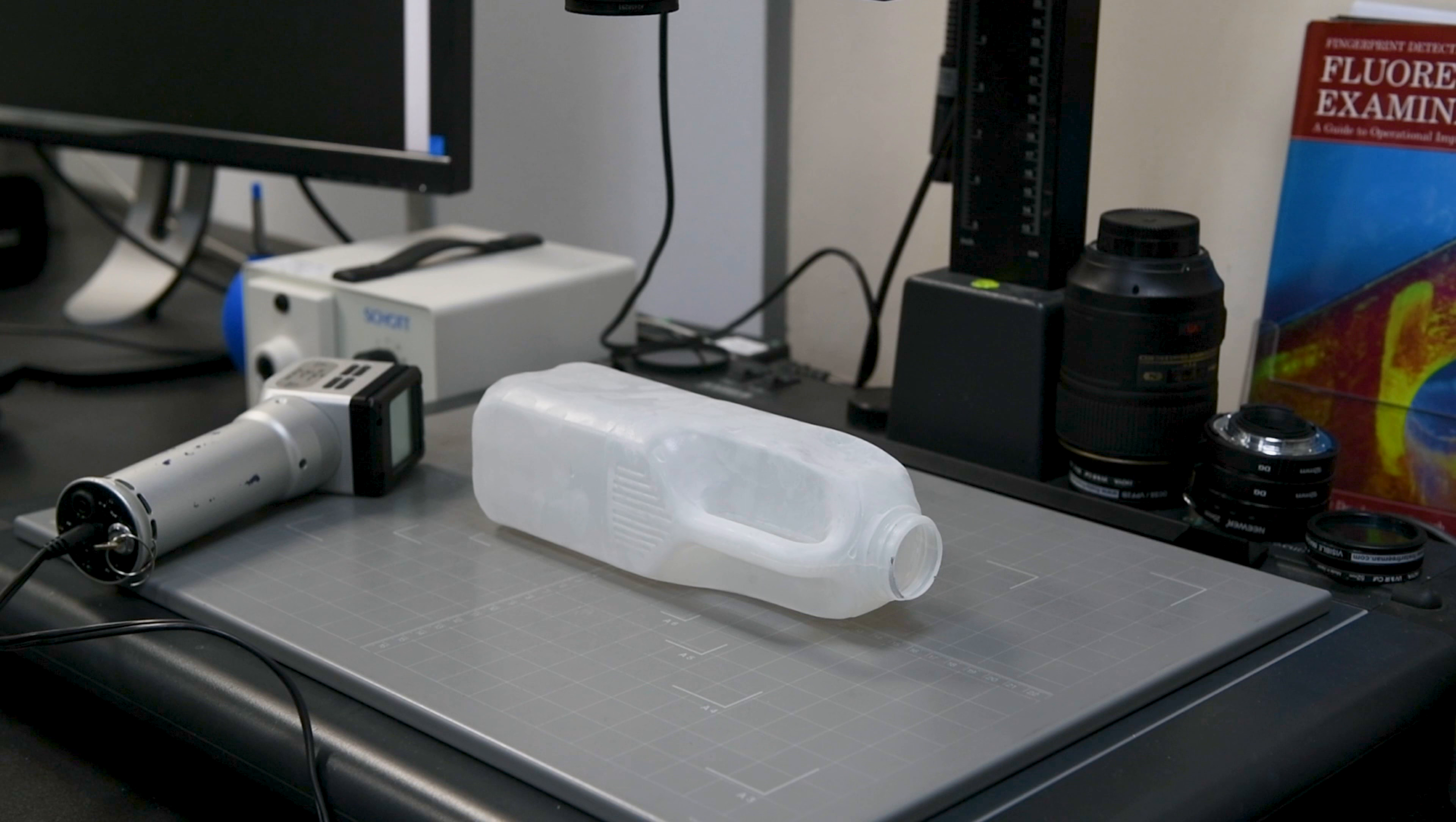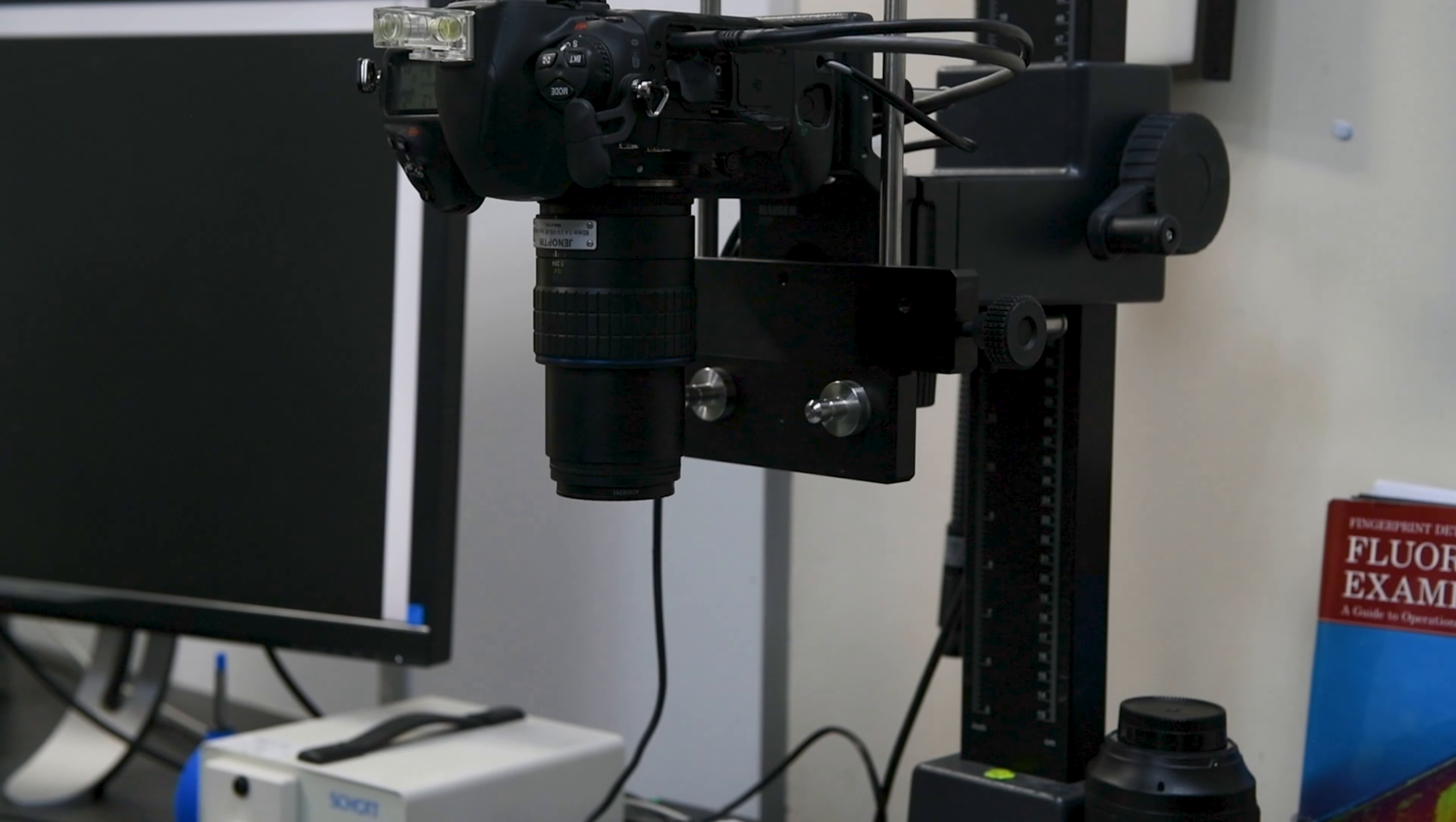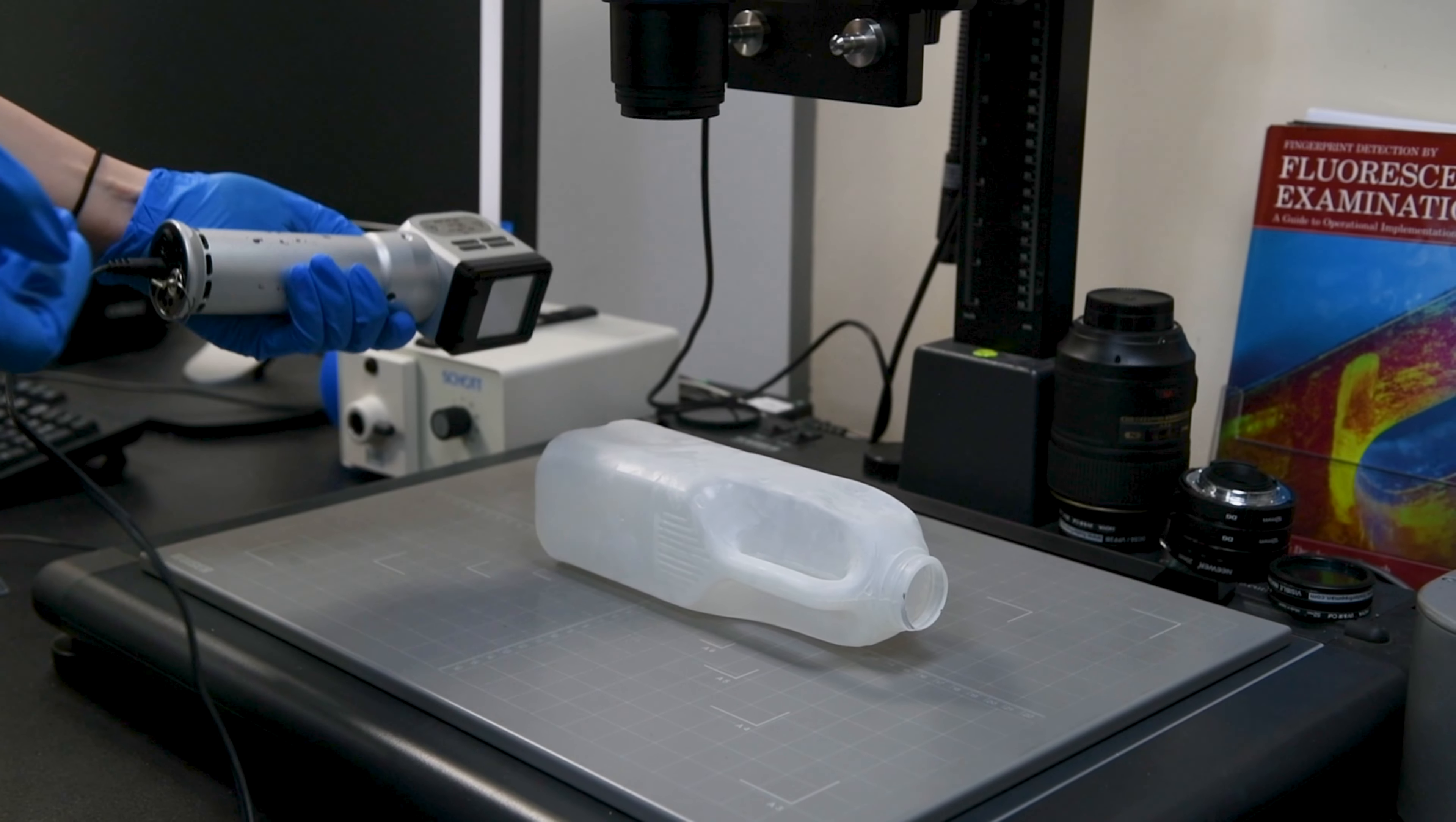The important thing on the DCS to note right now is that I have changed the lens. I'm now using a quartz lens and a special UV bandpass filter to ensure that the only light that's going to reach the camera sensor is the UV light that is coming from the 82S just here.